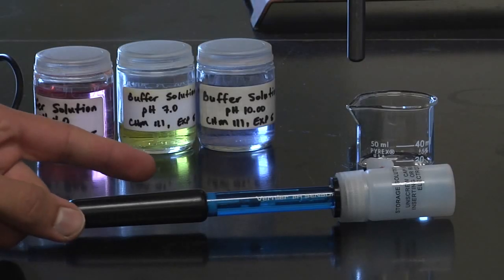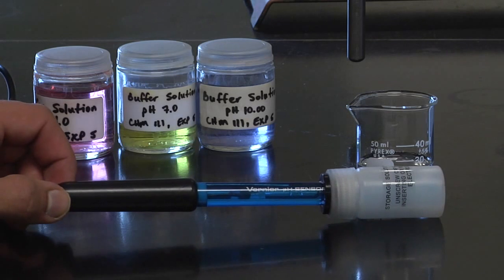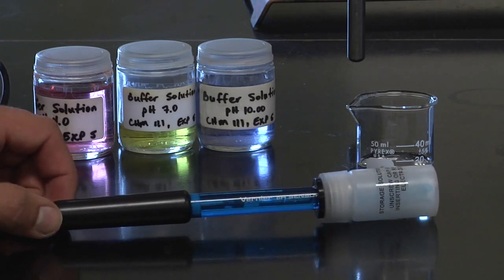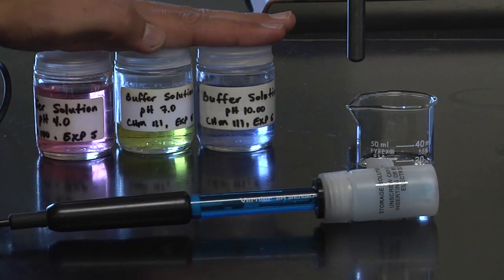For this lab, we're going to be using a pH probe, but before we use it to measure pH, we're going to need to calibrate it using these buffer solutions.